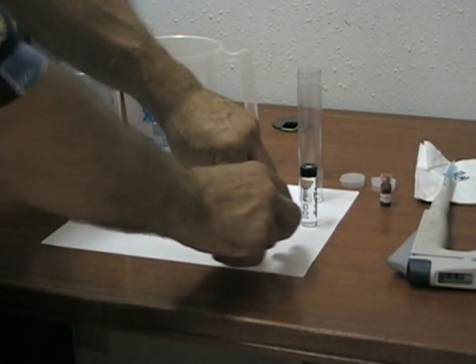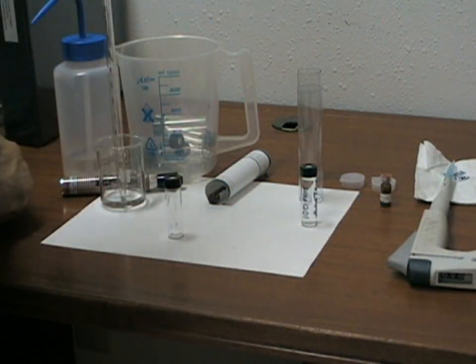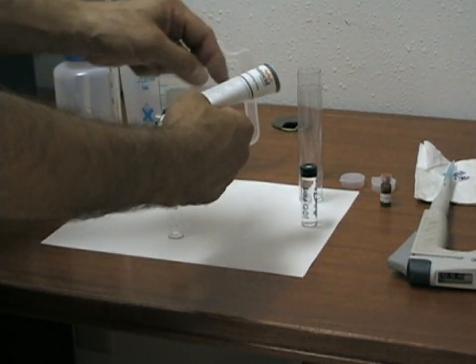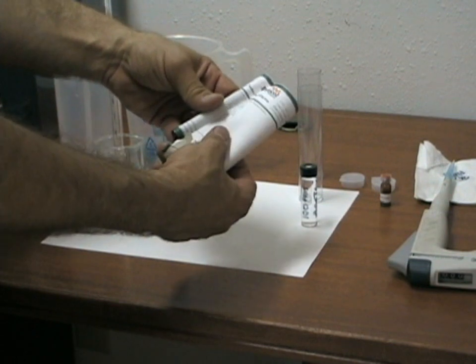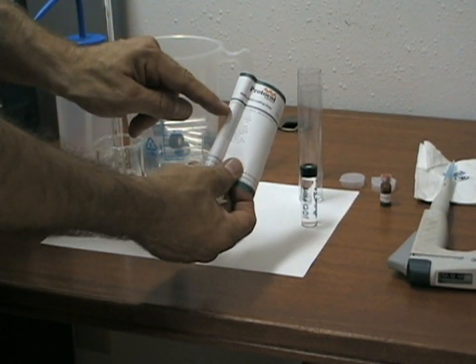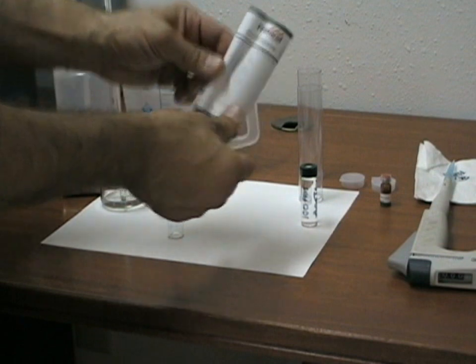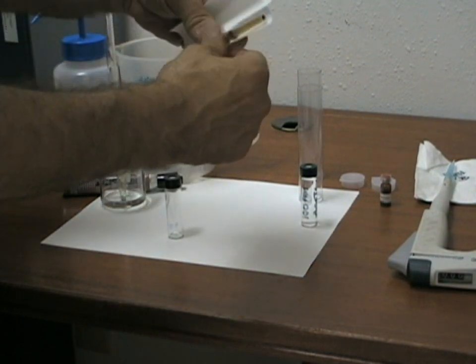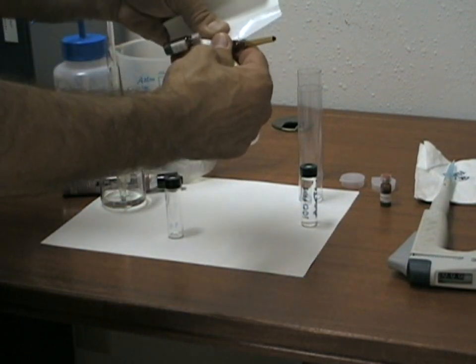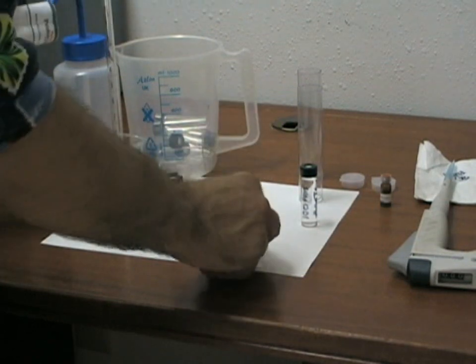We will do the same thing for the mixture of alcohols and esters which are present at 2,000 ppm on the label, so we will need to do a 1 to 20 dilution of this material.